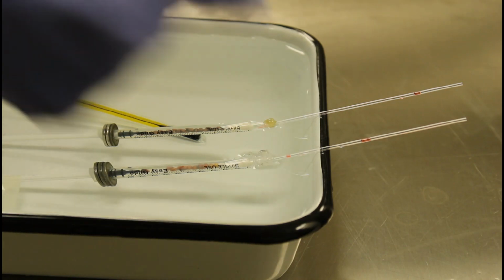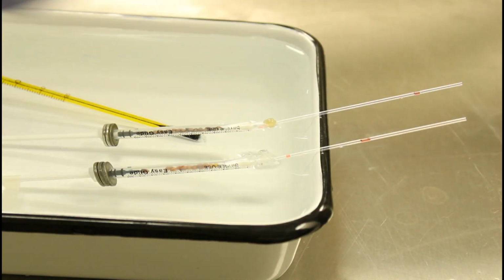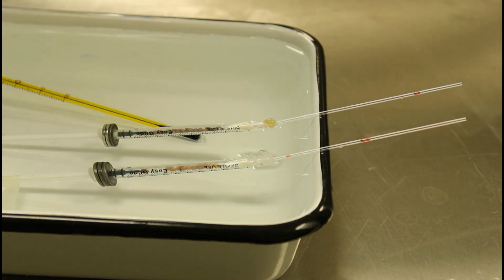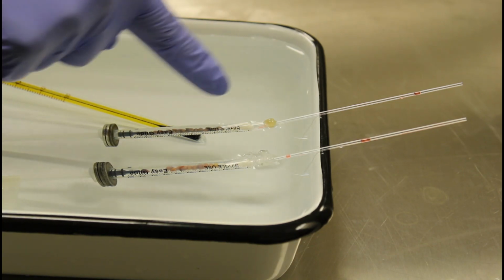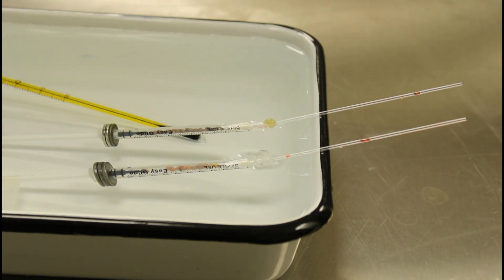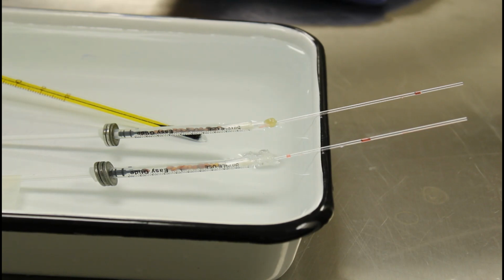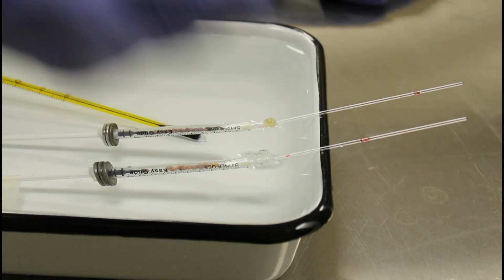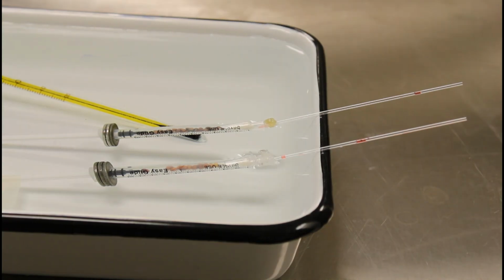So we do see some movement. The manometer fluid is moving towards the seeds, indicating that the volume of the gas is shrinking. That's a result of cellular respiration occurring in the germinating seeds, but we see that it's not happening in our control, which makes sense because those are not live seeds. So we'll check on this again in 5 more minutes, and we'll mark our manometer fluid position after 10 minutes.